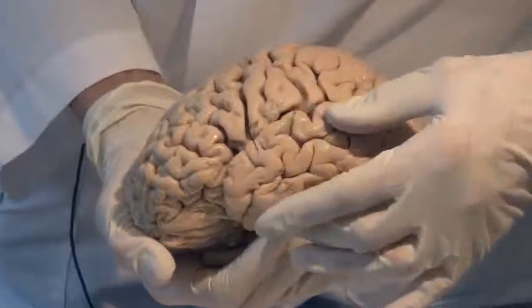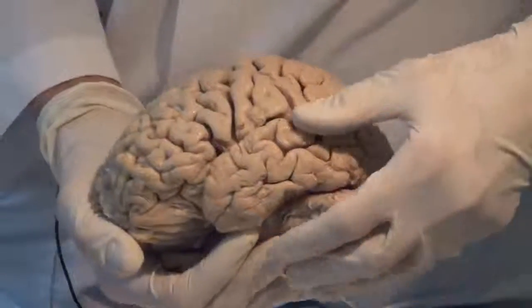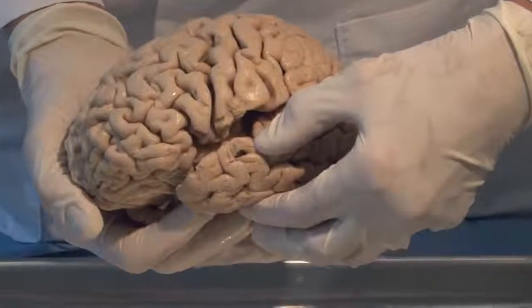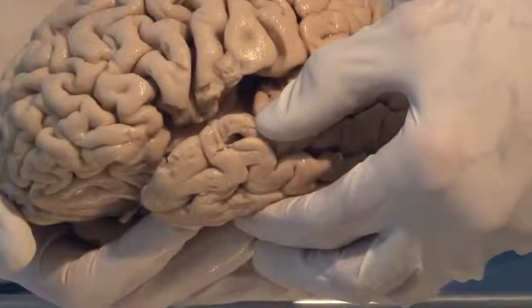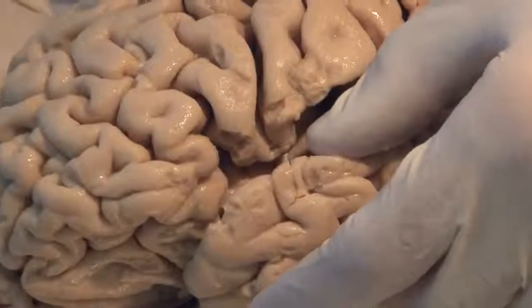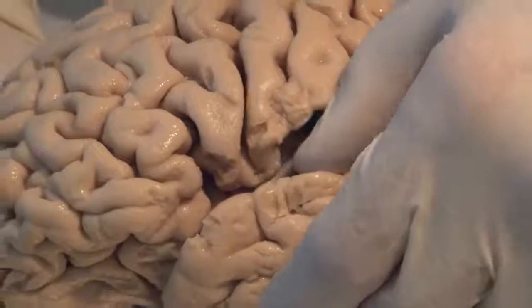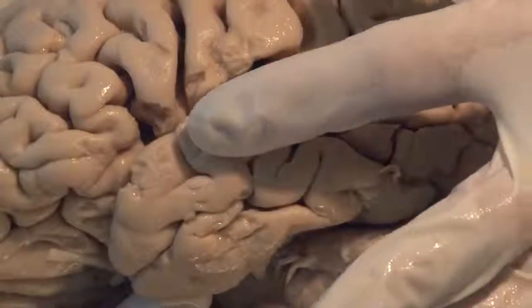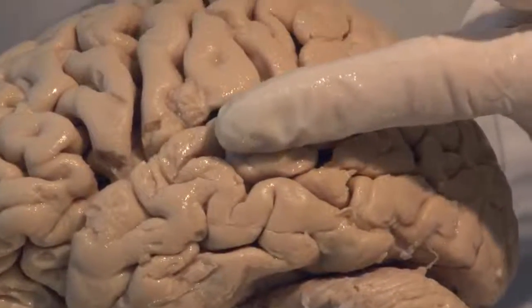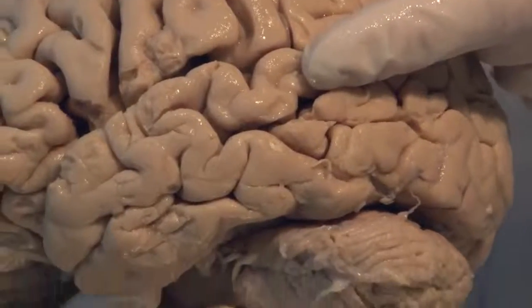And this temporal lobe that is down here is very much involved with auditory information, which is coming into this fissure here that I'm pulling down. This is the lateral fissure. And auditory information, sound, comes to both hemispheres and is processed here. And this area behind it, the superior temporal gyrus, this back part here is involved in the comprehension of language.